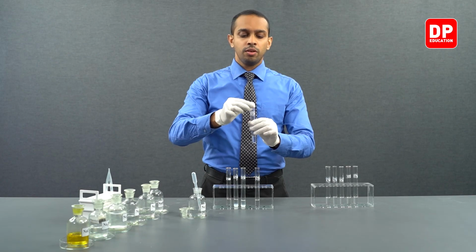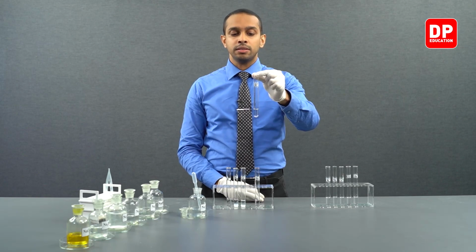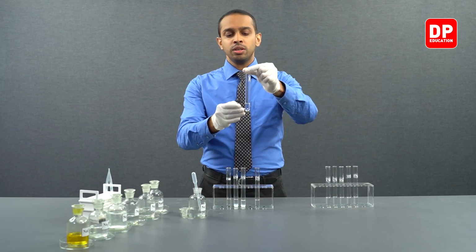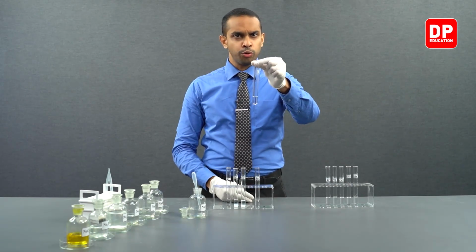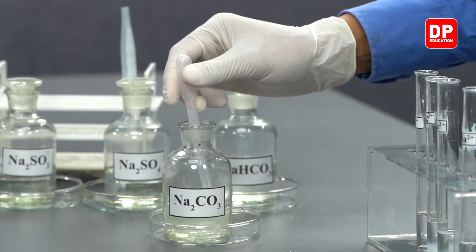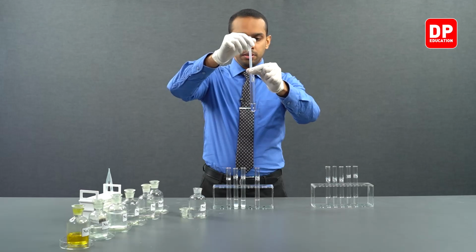Over here, we have strontium 2 plus aqueous ion solution. Now, take a guess. Before we add the carbonate ion into strontium 2 plus aqueous ion solution, what would be the observation? What do you think you would see? If you guessed a white color precipitate will be formed, you are correct.